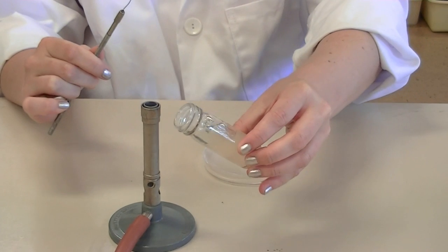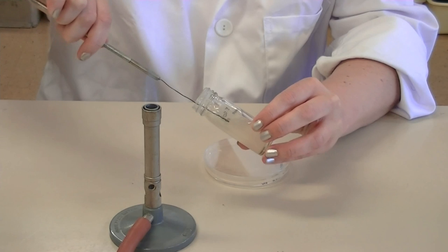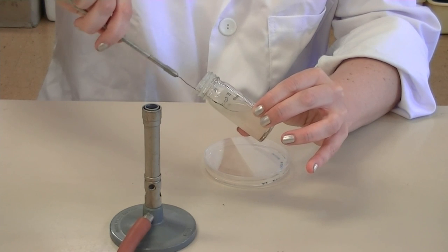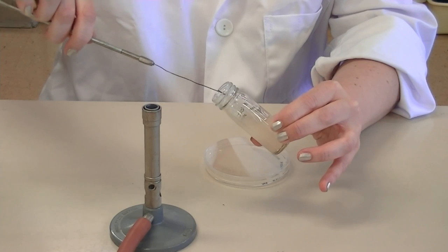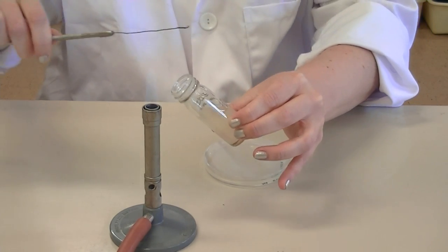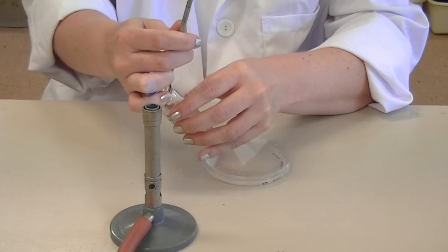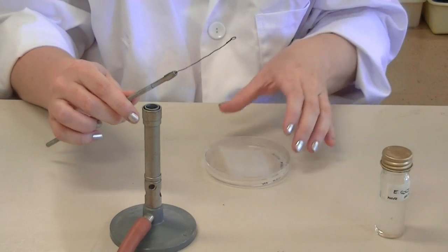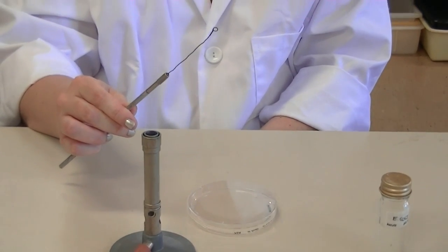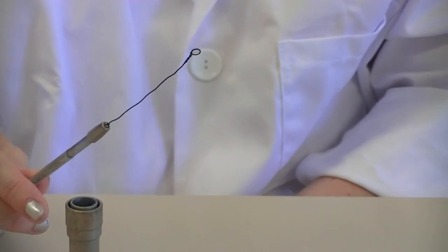Flame the neck of the bottle and then insert your sterile loop. Give your loop a swirl around in the culture to make sure you collect some on your loop. Then re-flame the neck of the bottle and replace the cap. You should be able to see the broth solution in your loop — it looks like a bubble, and you know that you've collected some of the culture to be transferred.